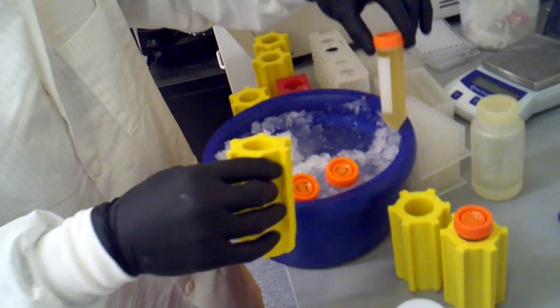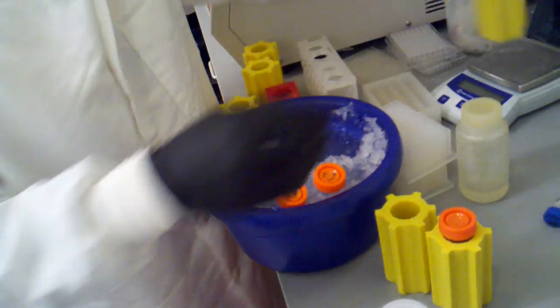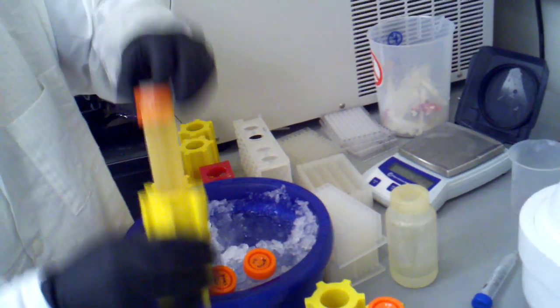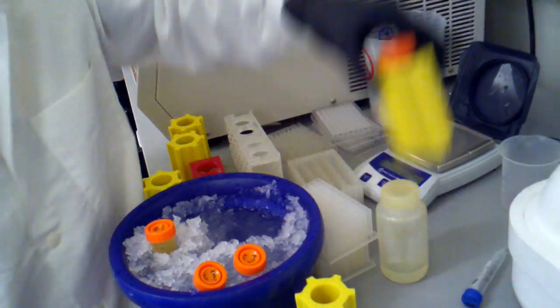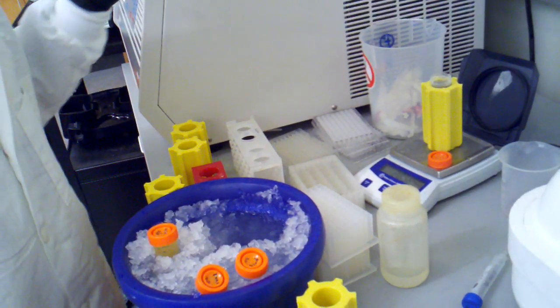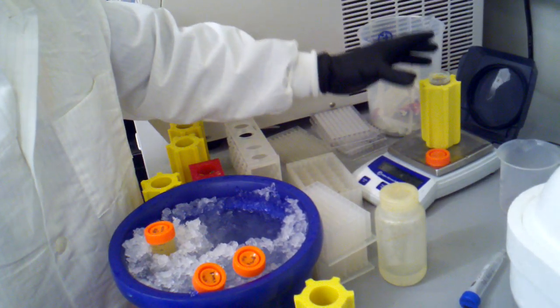Here's our actual cells. We're going to weigh those first because we're probably going to have to adjust the other a little bit more. So that comes out to 205.8. This goes back on ice. This comes out to 205.8. How about that? That's just incredible.